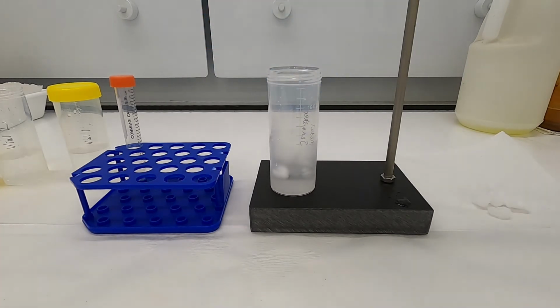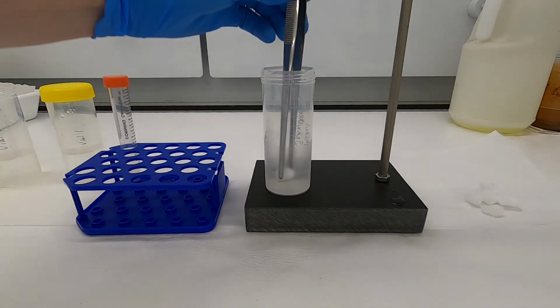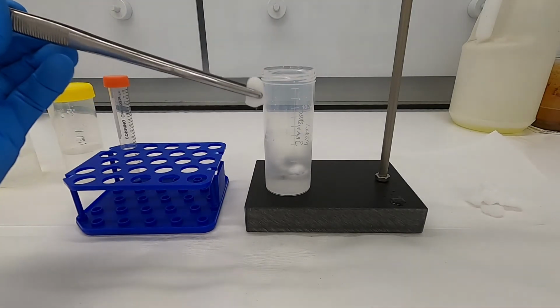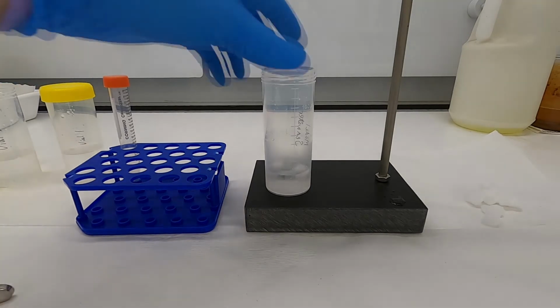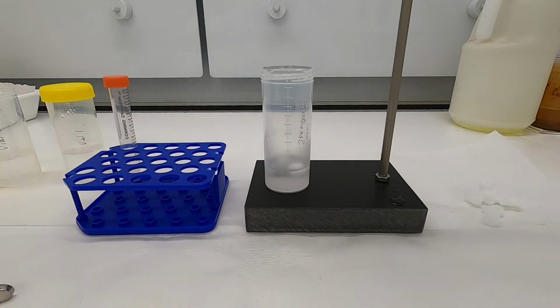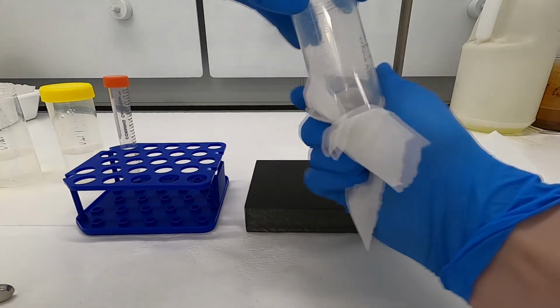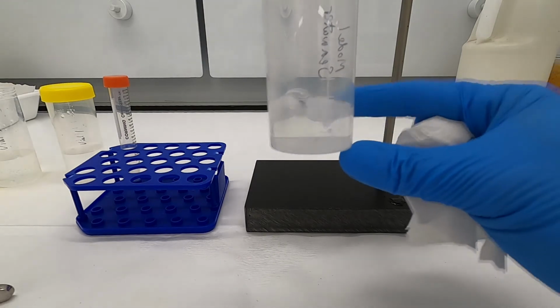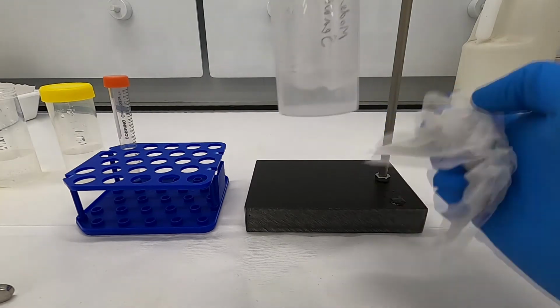So our CO2 is about finished here. I think what actually happens is that over time, these pieces of dry ice actually begin to freeze water, to form water ice around them. So just get rid of that so it becomes a bit more clear. But what I think we can start to see is that our precipitate is just about gone. So if we wipe this off to remove the condensation on the outside of the tube, we no longer have that opaque white precipitate.